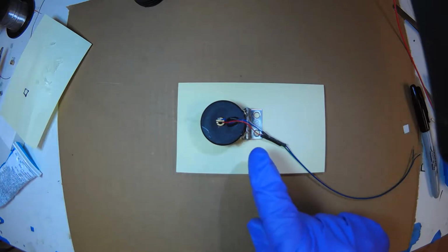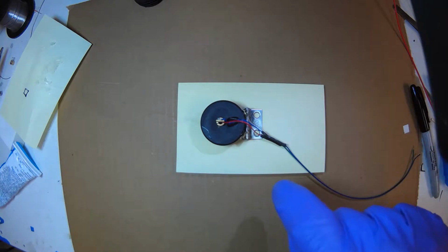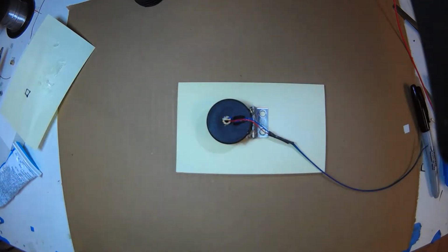The other thing is we have to get this wire into the box. We have to drill a hole in the box and get the wire in so we can hook it up to the Pi to get power for the LED. And we have to put the resistor in series. Now that that's hardened, I can fill in the blanks.